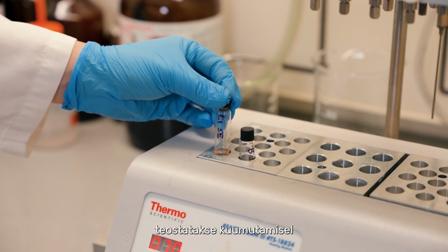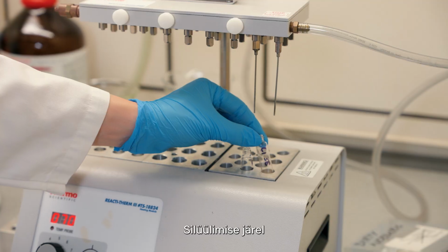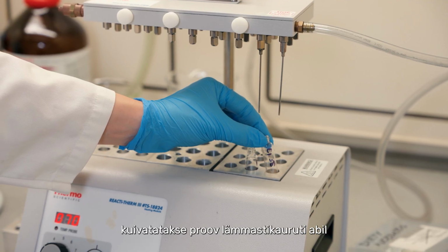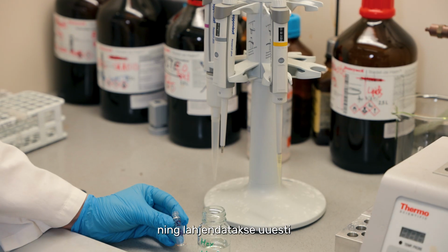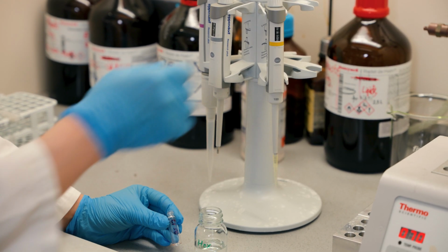For silylation, the heating process will take 1 hour at 70 degrees. After silylation, the sample will be dried down under nitrogen and then reconstituted with 100 microliter of hexane into the GC vial.